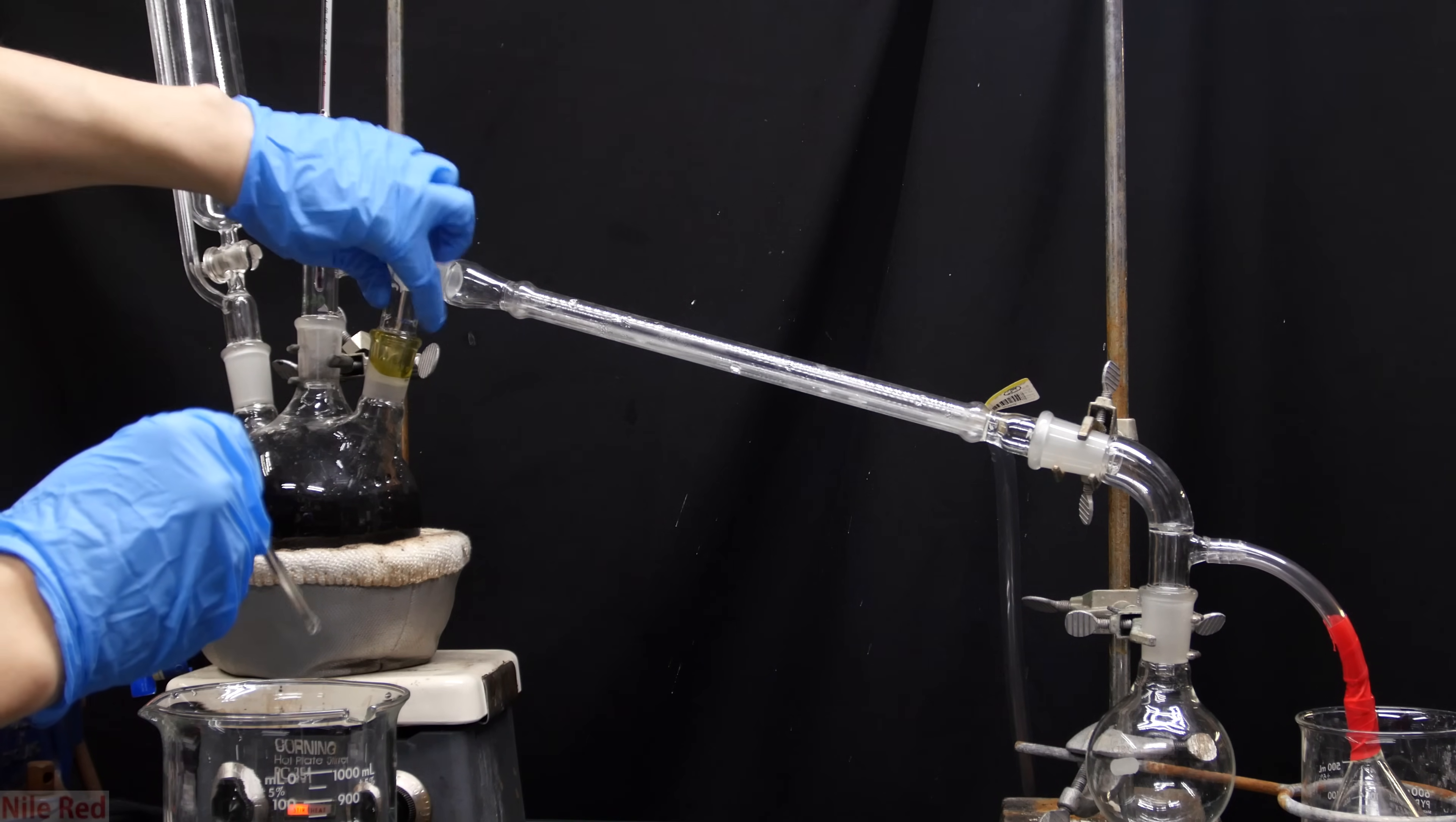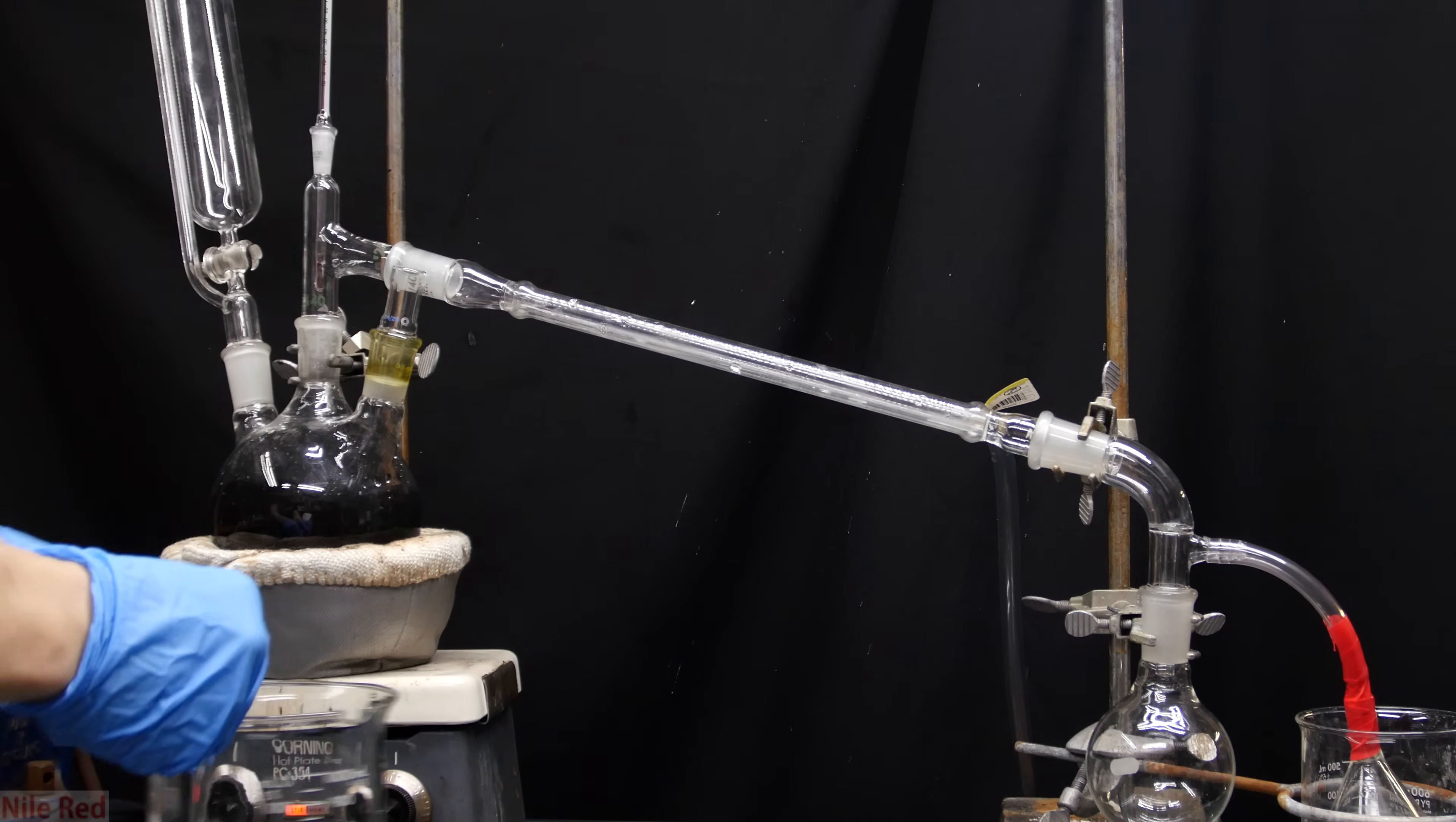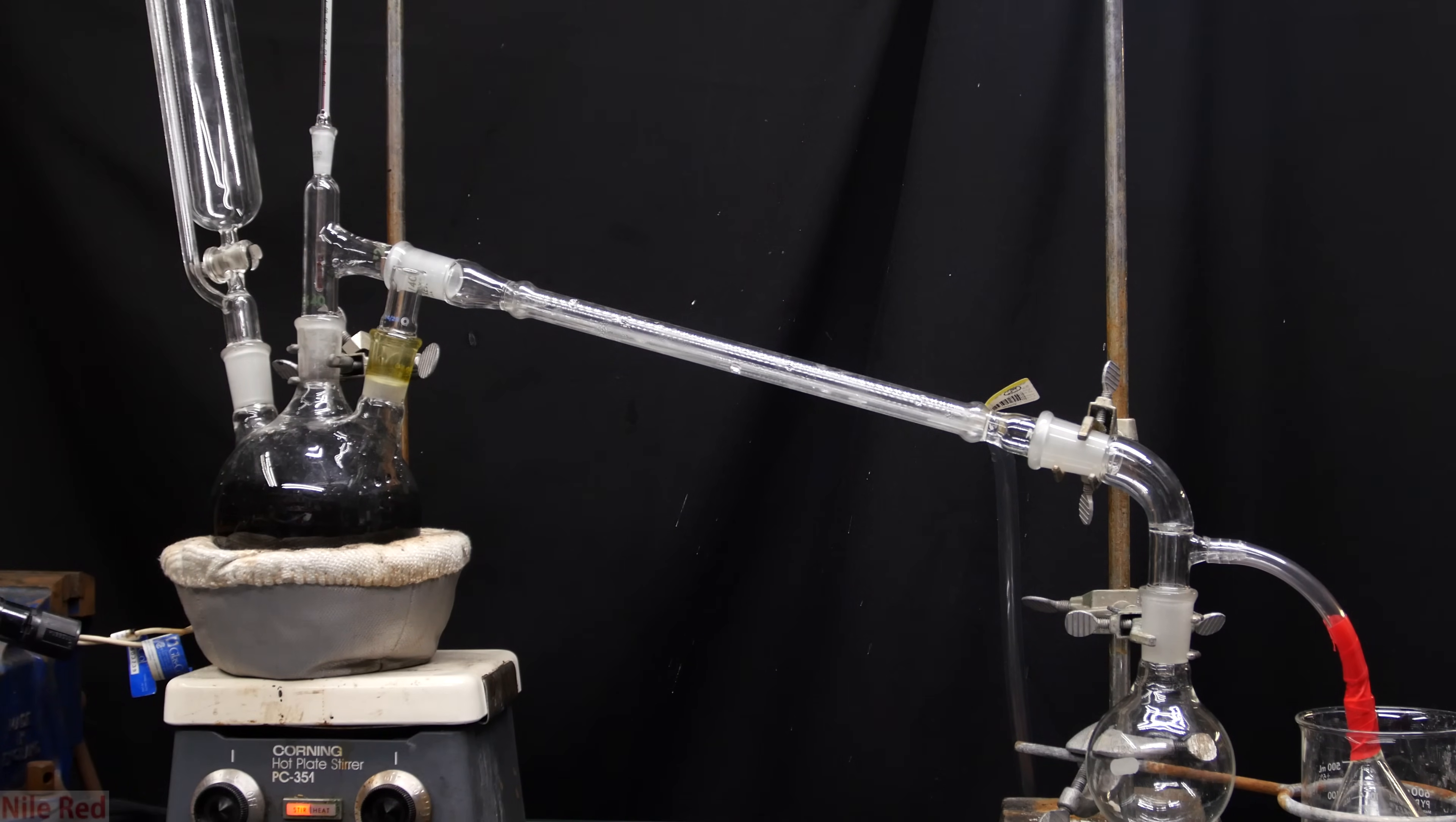You can see though, when I put the stopper back in, the sulfuric acid reacts with something in the joint. I'm not sure what this is, but it won't affect the reaction. I guess I just didn't clean the flask as well as I thought.